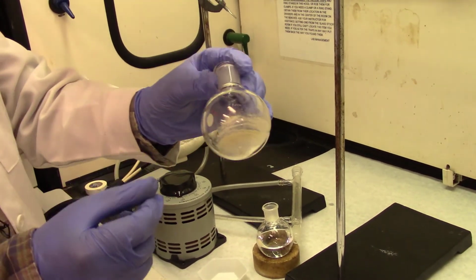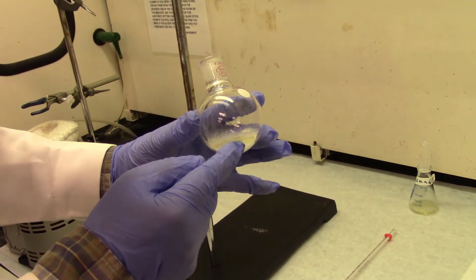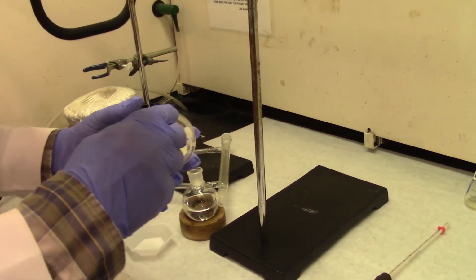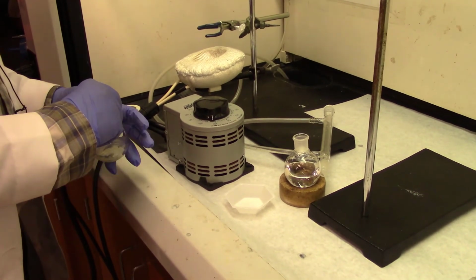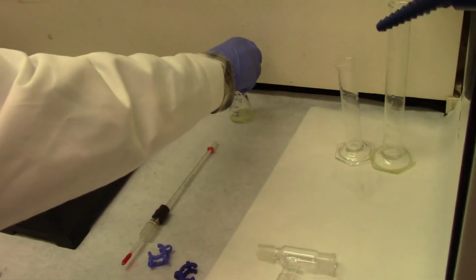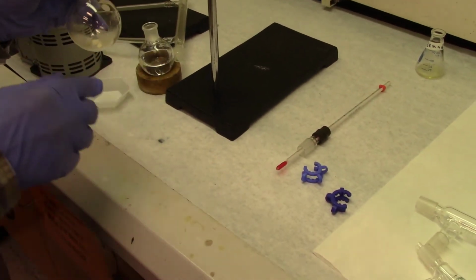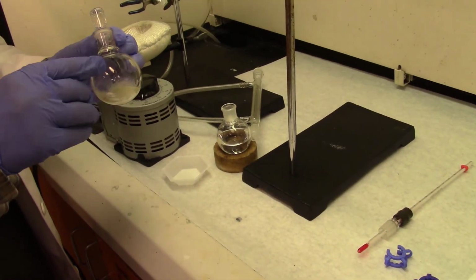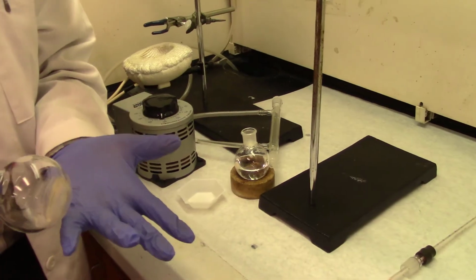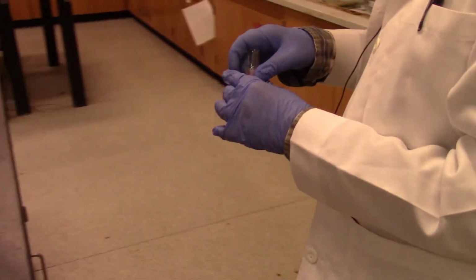Still it's hot, well, not very hot, it's warm. So you want to make sure that you stopper it first, because remember, caffeine is volatile because it can sublime. Therefore, it's a good idea to stopper it. Stopper the flask to stop sublimation and the loss of product. Okay, you stopper it, and now you want to cool it. It's a very good idea to cool it under running water. Another way is to just wait, but the best way is to cool it quickly under running water.